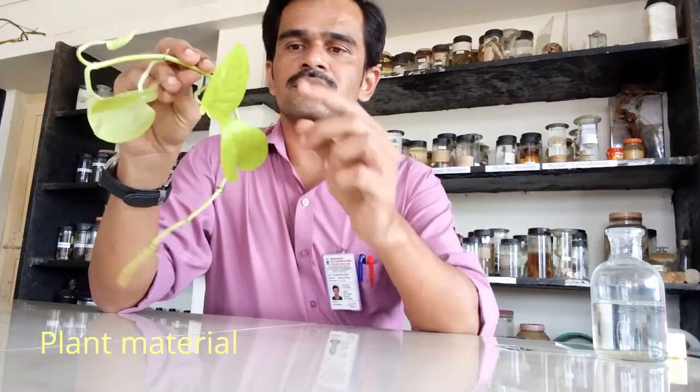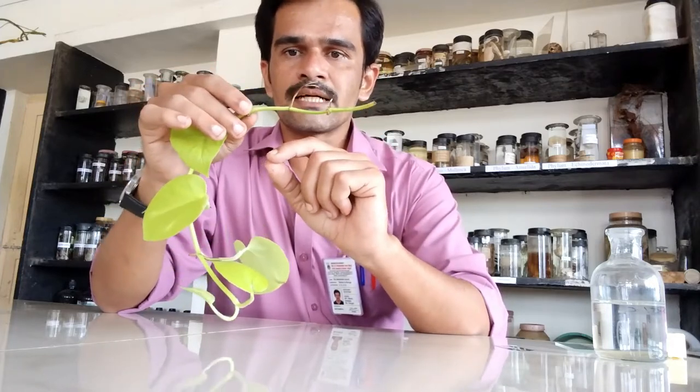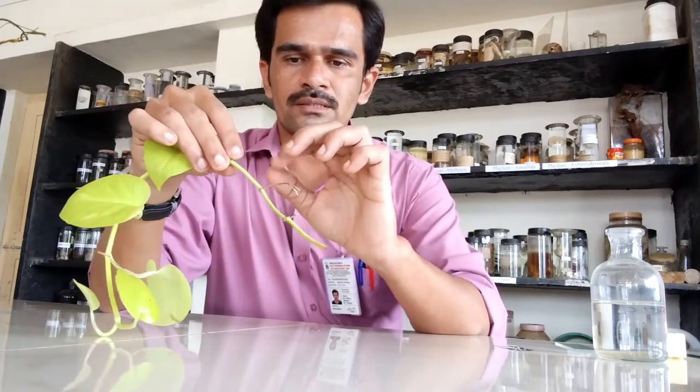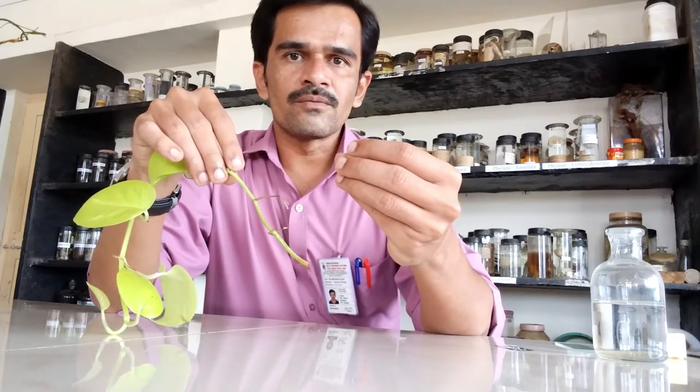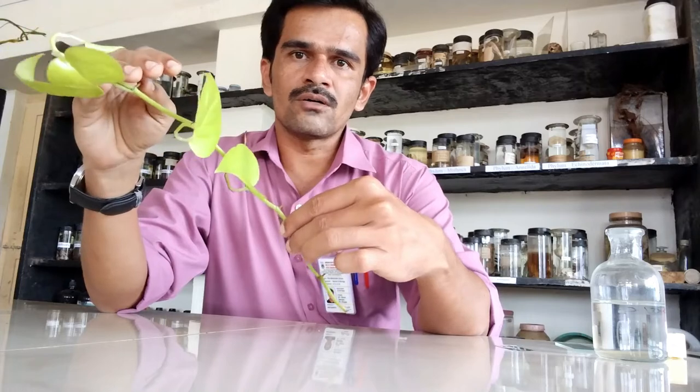Let's start by taking a plant material — these are the leaves. We need to study the stem and the tissues present inside it. The stem contains many conducting tissues; xylem is responsible for conduction of water from the root up to the upper shoot region, while phloem is responsible for conduction of food material inside the plant.